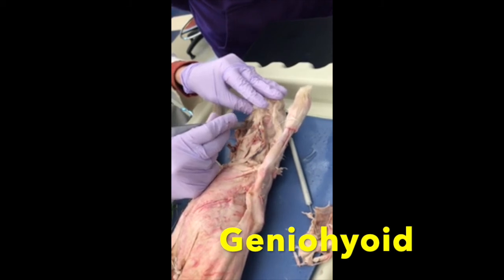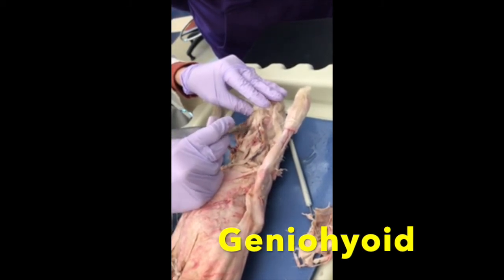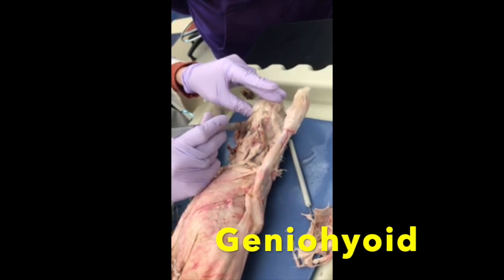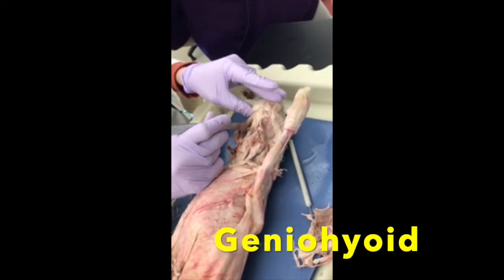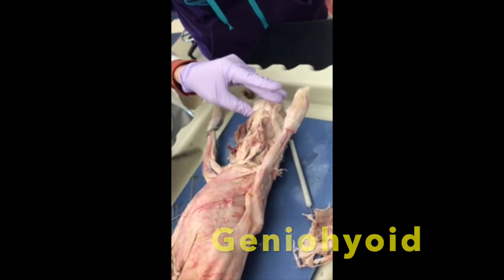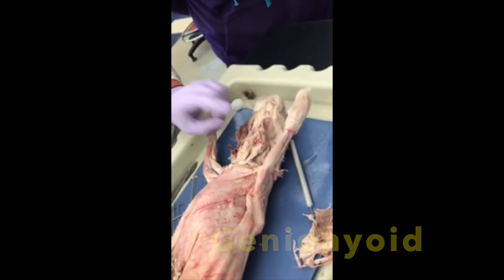Just gotta peel it back. Okay, so beneath the Mylohyoid is the Geniohyoid. Genio means chin, still going to my hyoid.